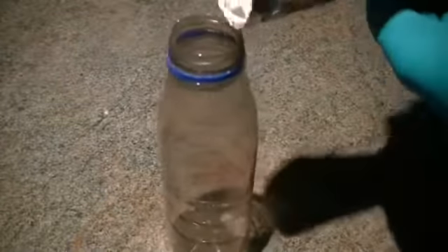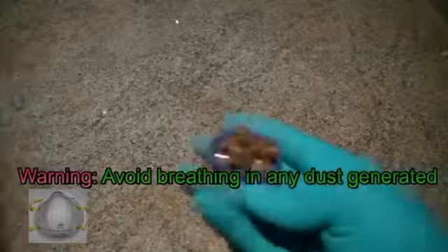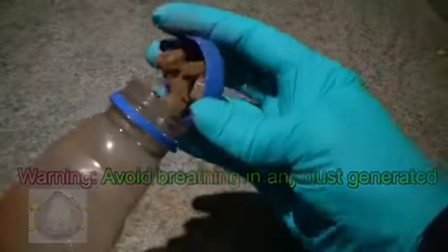To turn this clumped powder into a finer powder, one option is to use a homemade shatter box. So to do this, we can use a plastic bottle, which we add our clumped powder in. To help break it into a finer powder, we can add some nuts. Just carefully screw the top on, and then we shake it. Now the nuts will impact the coarser powder, breaking it into a finer powder.